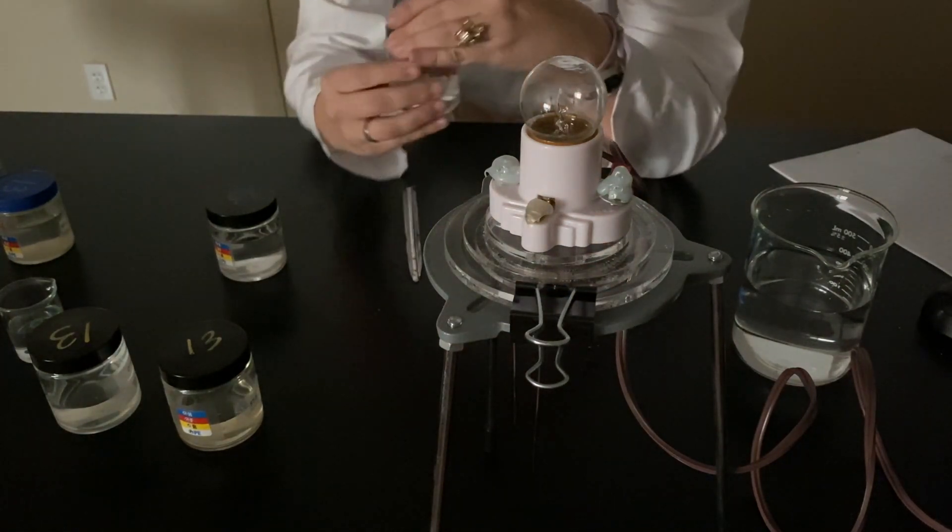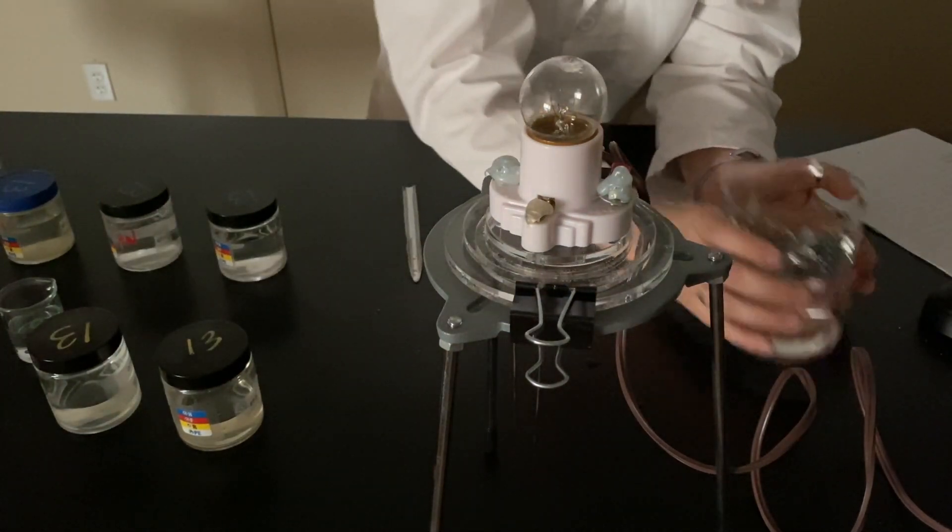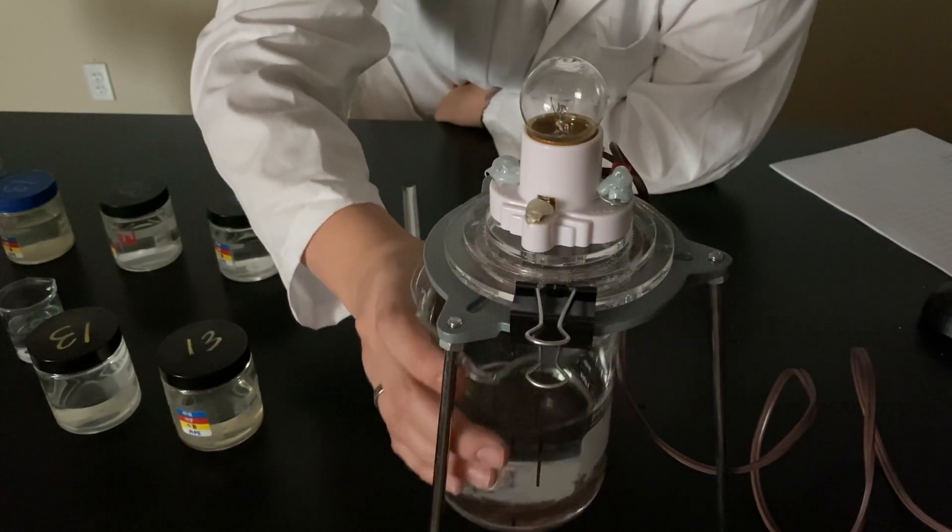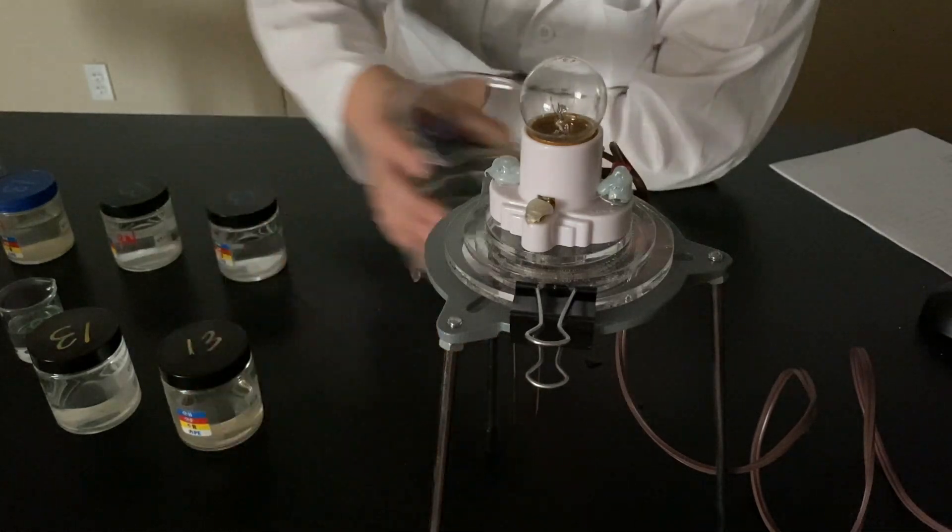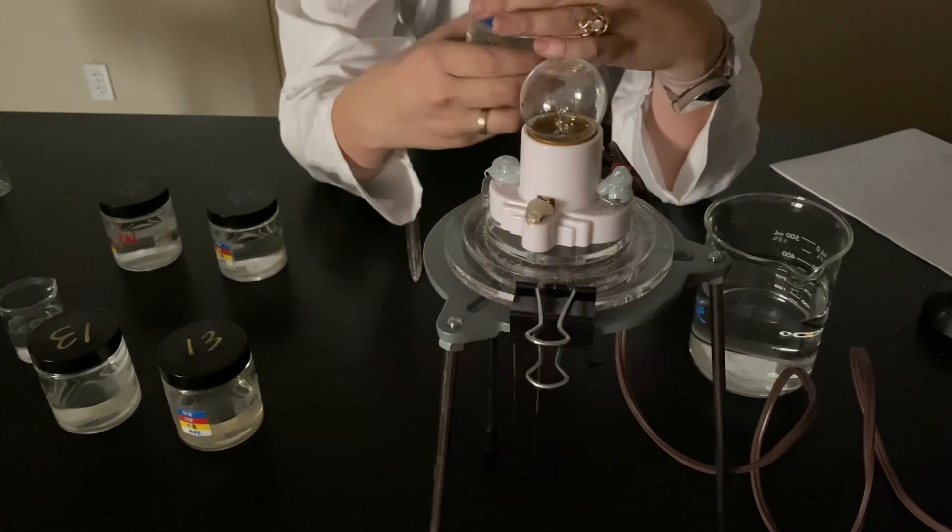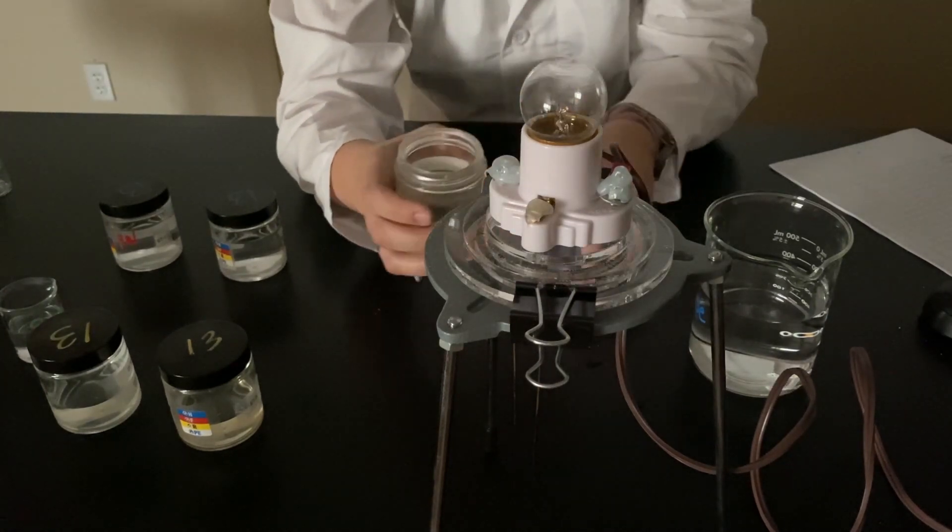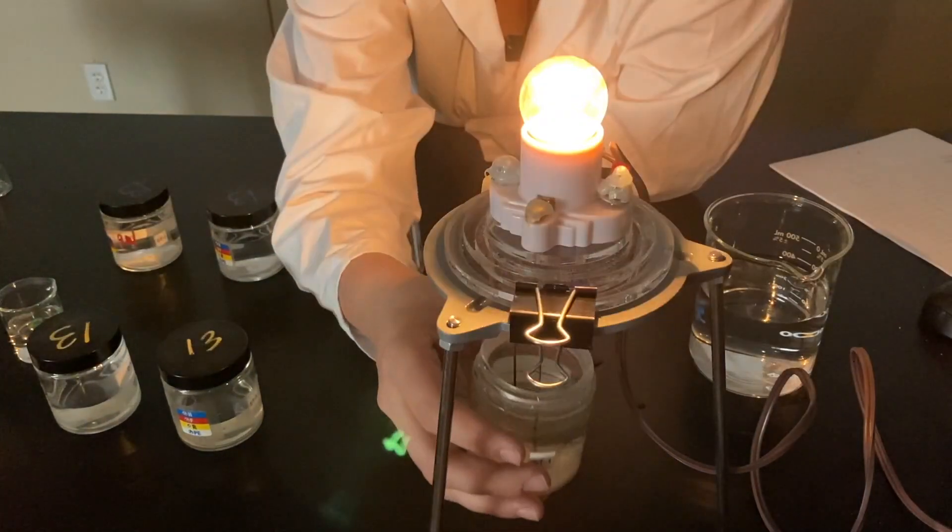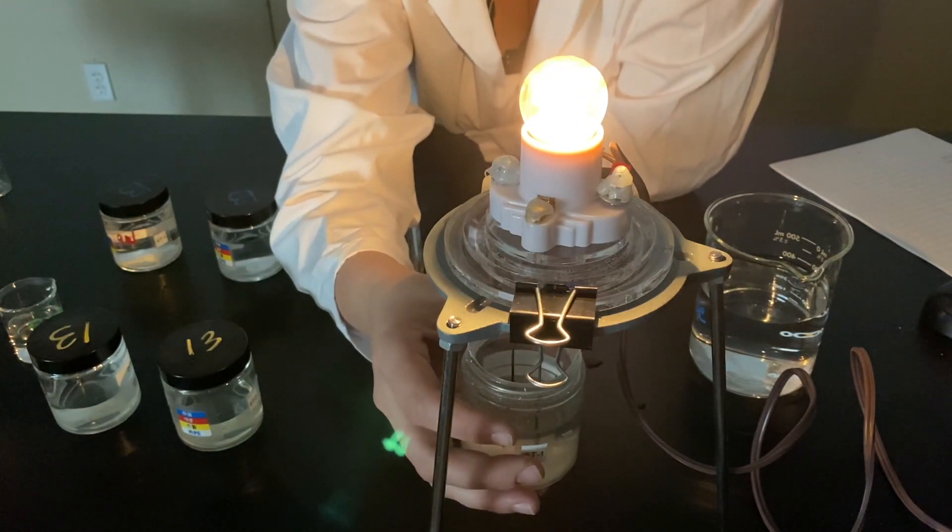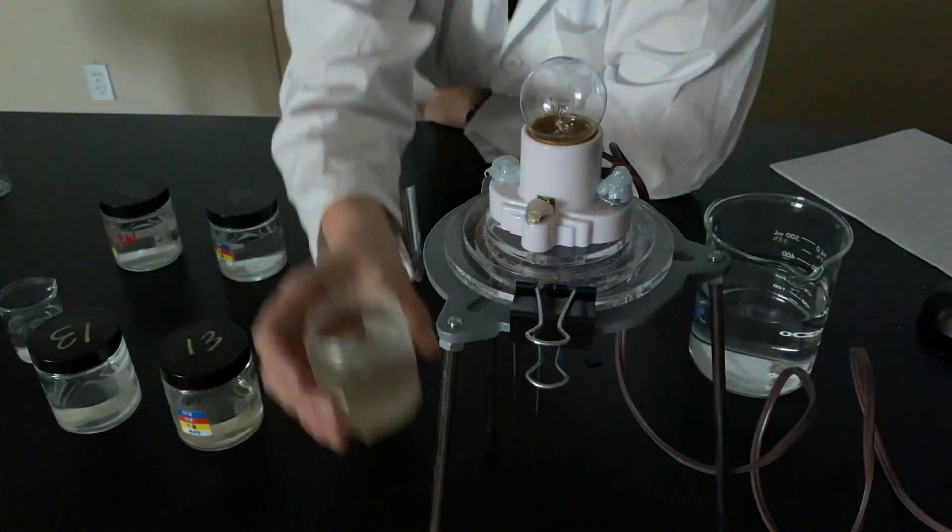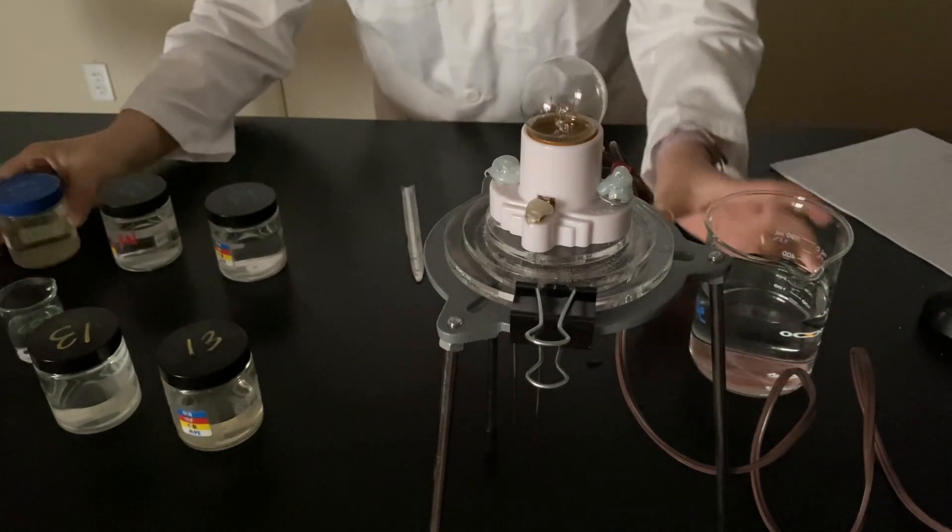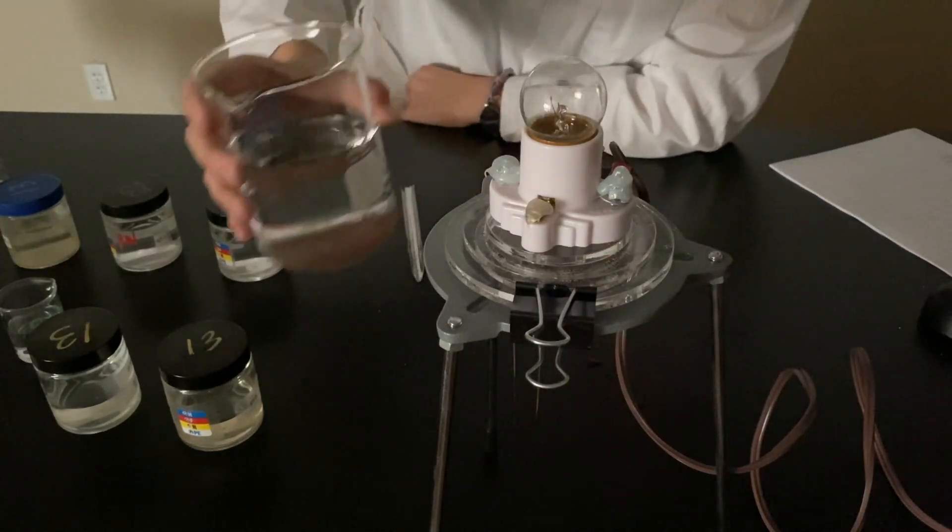Okay, so we're seeing those strong electrolytes, so those are going to be strong acids. We will definitely be talking about that soon. It all connects. All chemistry connects. What's next? 0.1 molar sodium hydroxide. NaOH. It's a base. It's a strong base.